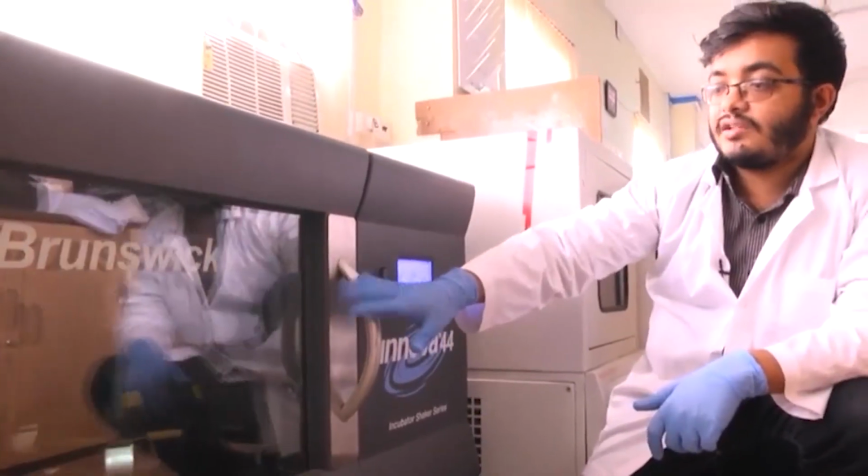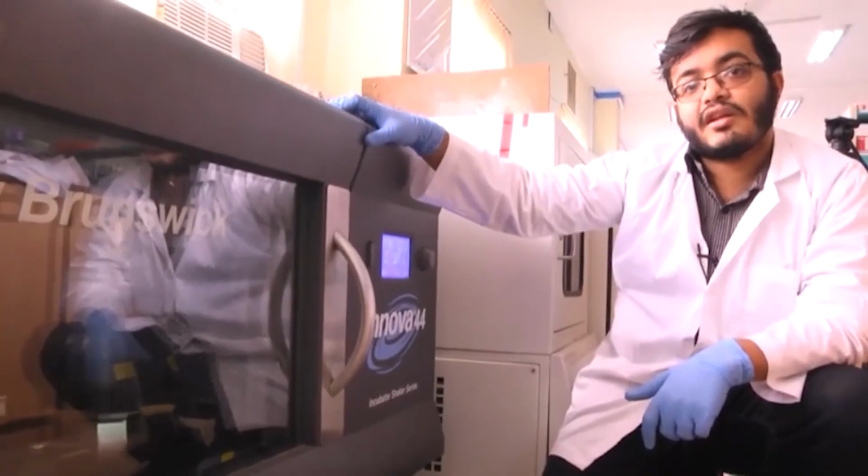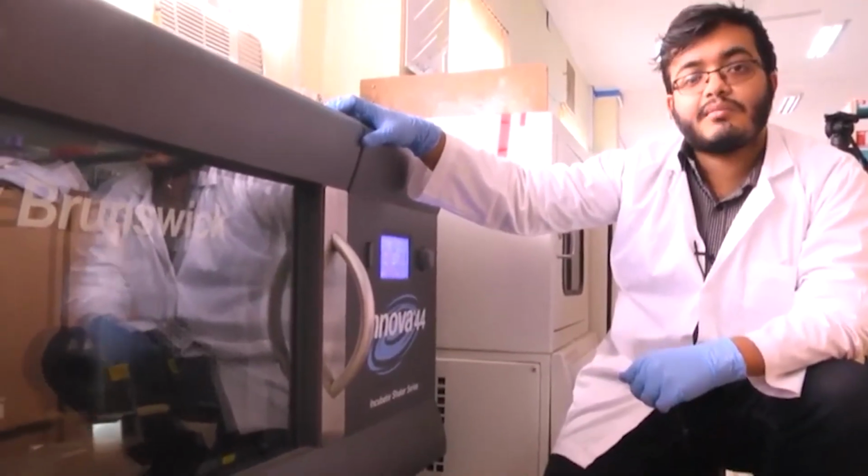So, for now what I did was just give you a flavor of the instruments that are necessary for carrying out work in molecular biology and biochemistry.